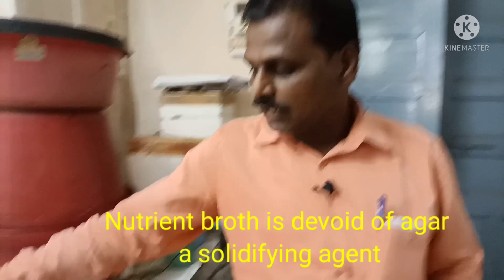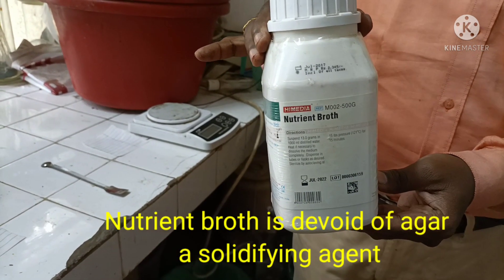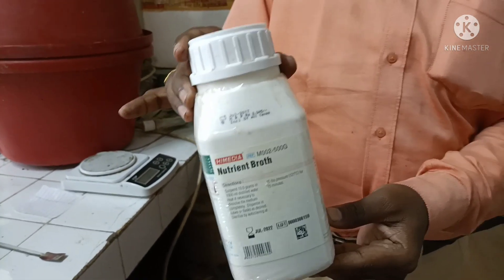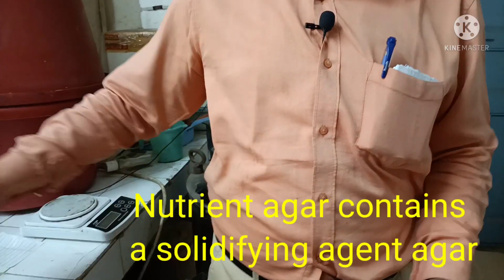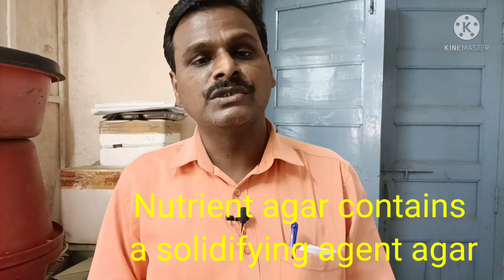Nutrient broth and nutrient agar are of the same composition. The only difference is that nutrient broth is devoid of agar — the solidifying agent is not added. In nutrient agar, agar is added as the solidifying agent.